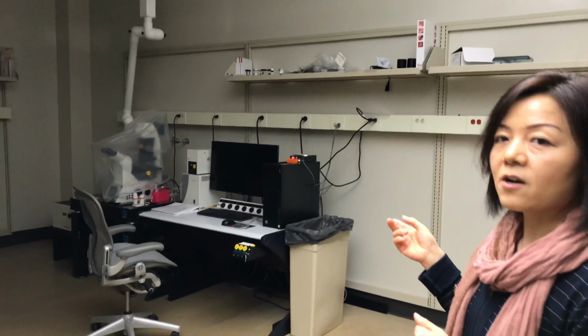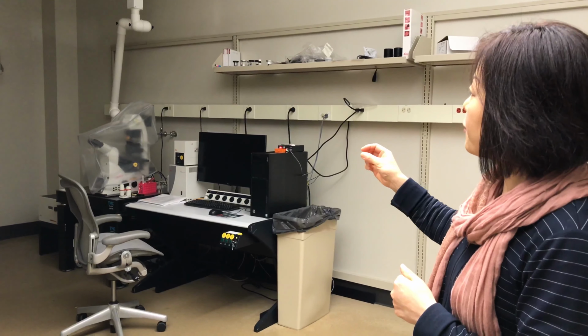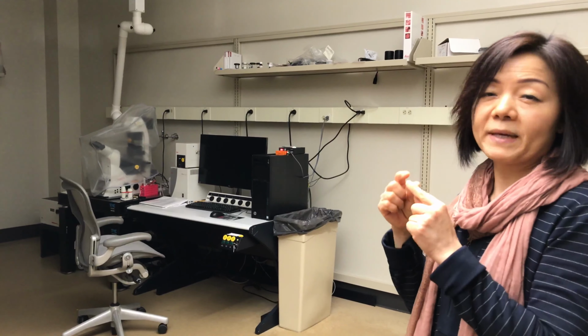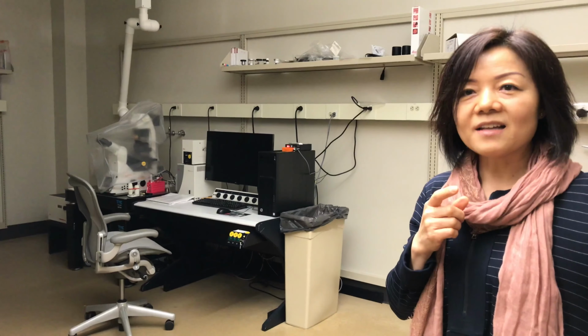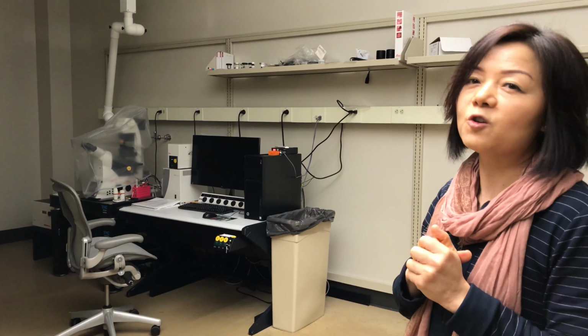Newer fluorescence microscope from Leica. It's called SP8, the model. Basically, the confocal is realized by the pinhole. It's like a mechanical device. And the other one I showed you earlier, DM6B, is also a confocal light microscope. That one is realized by software.